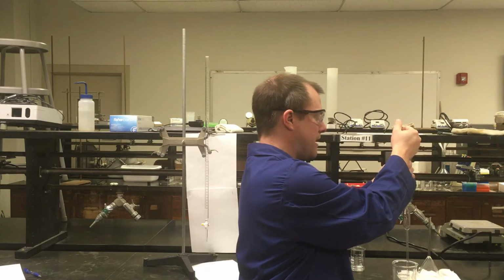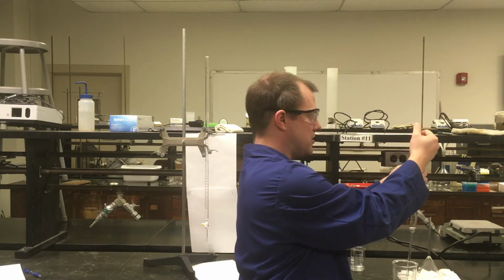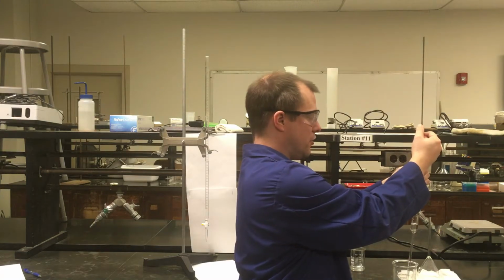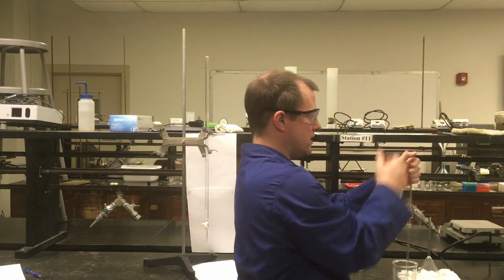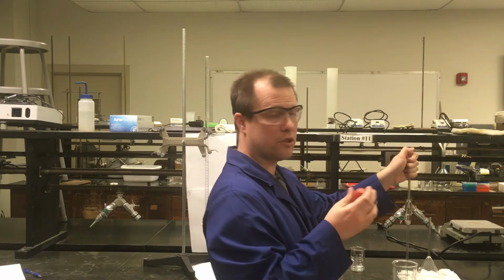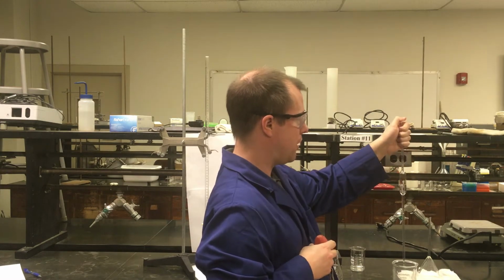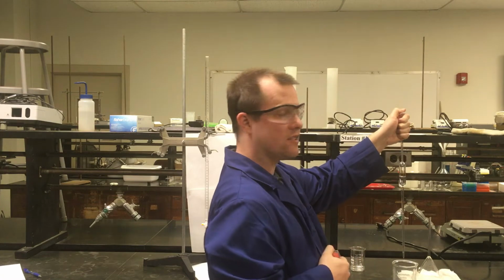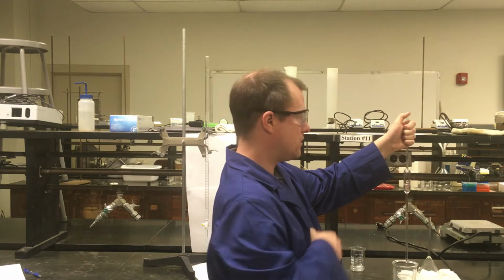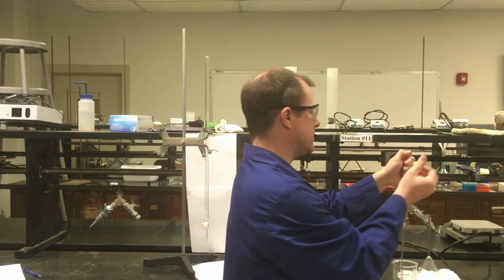But since this pipette is so large, even if I let the bulb expand as far as it possibly can, you're going to notice the liquid level, if you can see it, is still only right about here in the pipette. It's only about halfway. And notice what I did as soon as I took the bulb off, I capped the pipette with my thumb. The reason is that keeps the liquid sealed and keeps it from draining out. Because as soon as I let go of my thumb, you see the liquid level start draining. So that's how we control the liquid level inside the pipette.